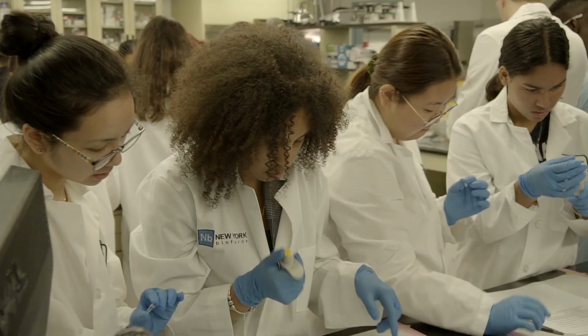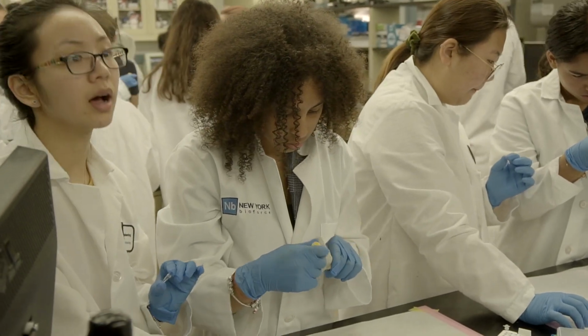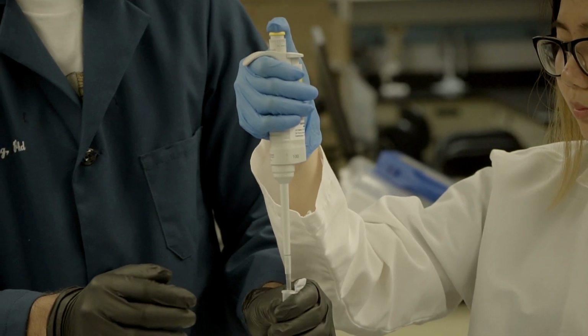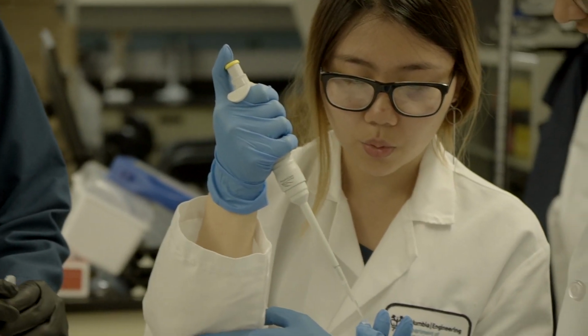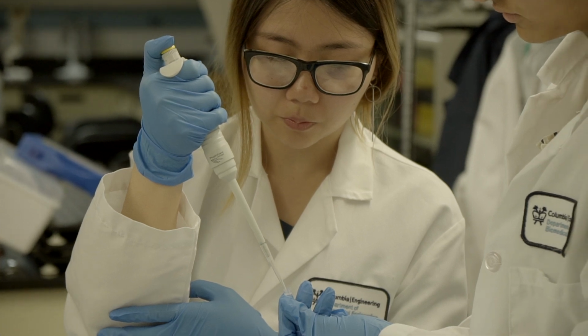And then it's 10. Lots of these reactions will have, we end up having 12 groups, which I think should still be okay instead of 11, because they're using each of the things. We didn't say to not use one of them, but we still have enough reagents. Okay.